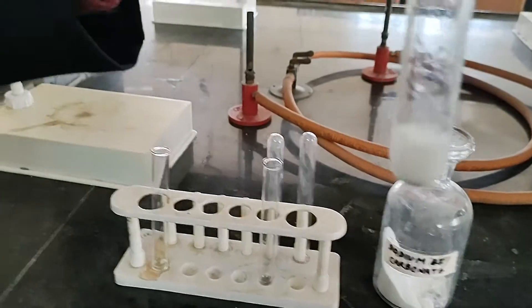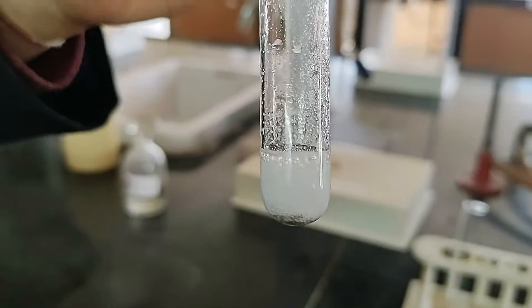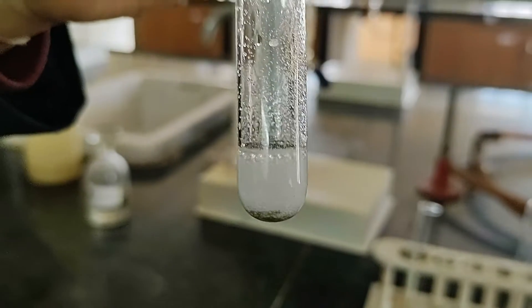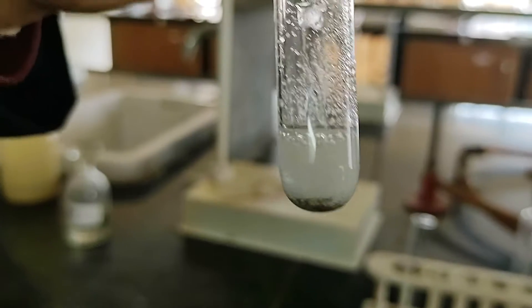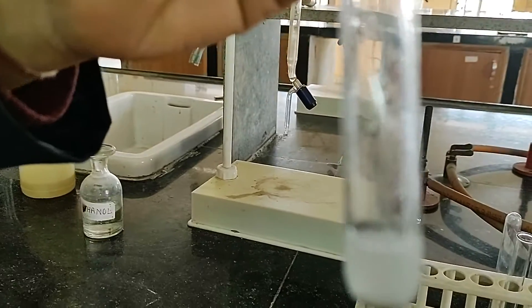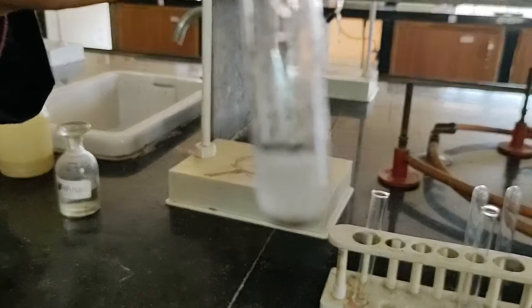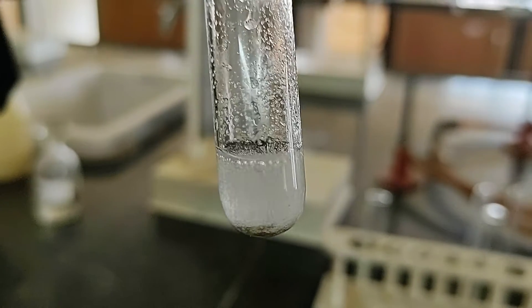See the results. Brisk effervescence is produced. This shows that the gas released is CO2. You can see easily that brisk effervescence is being released. This indicates that the functional group present in your organic compound is COOH — the carboxylic group.